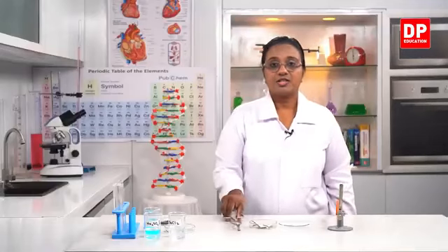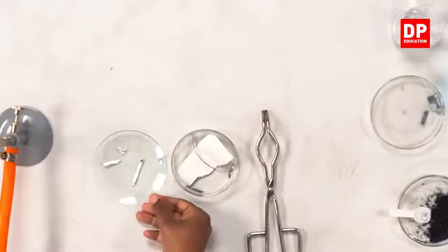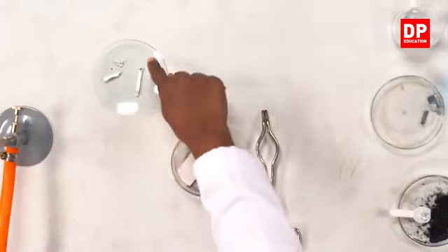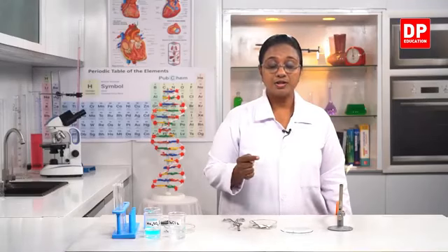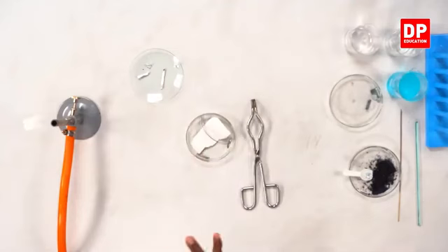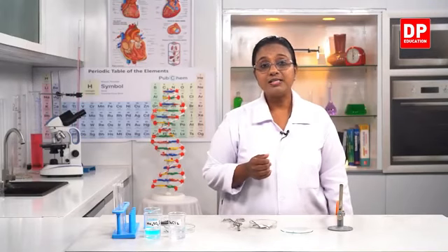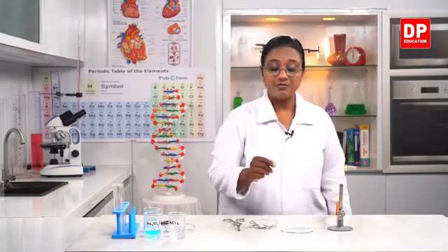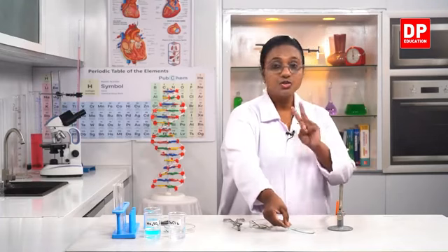So in this reaction, you all can see this chemical change. This is the reactant, the magnesium strip. Okay, I'll show it to you all, students. This is the magnesium strip and this is the product, the white color powder. In this reaction, magnesium is one reactant. The oxygen gas that is around us, when there is combustion, oxygen will be used up. So when we hold the magnesium strip to the Bunsen flame, it will burn. Then the magnesium reacts with oxygen. So two reactants and there is only one product formed.